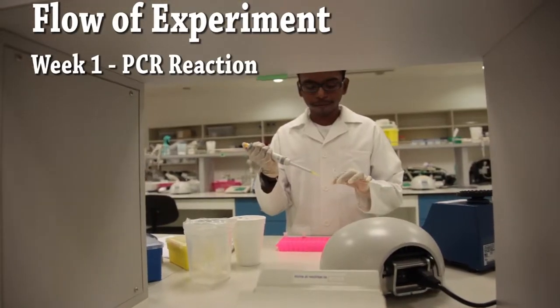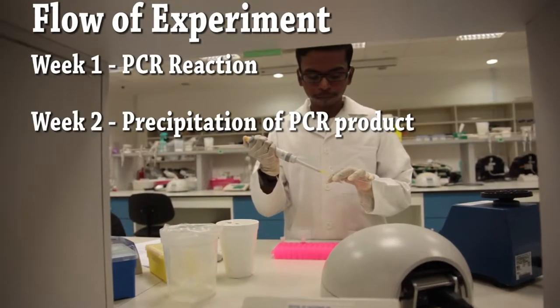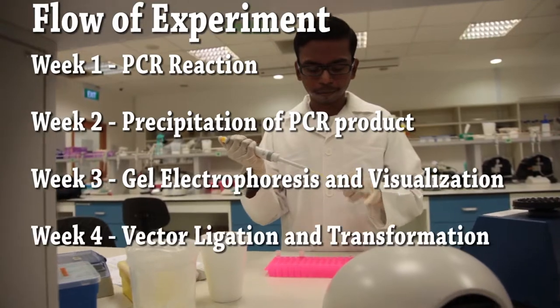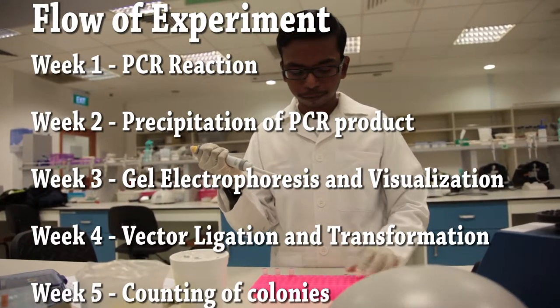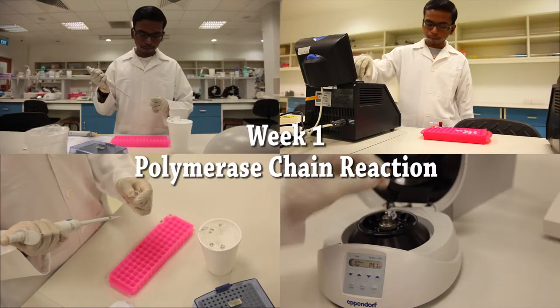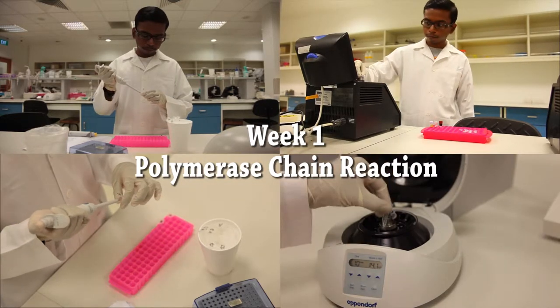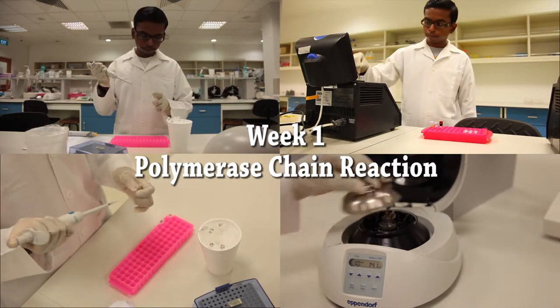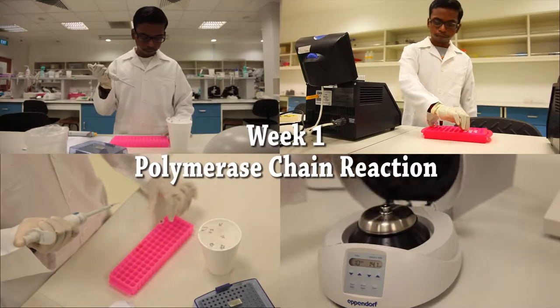Flow of the experiment: This practical consists of five experiments carried out over a five-week time frame. This is part one of a two-part video of the entire experiment. Let us now proceed with the first experiment, polymerase chain reaction.